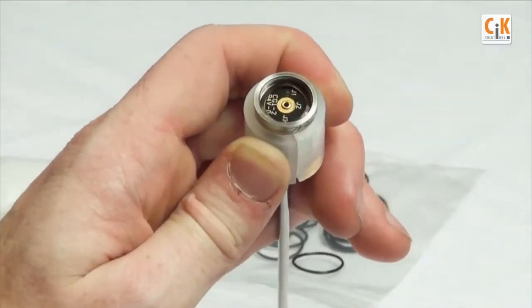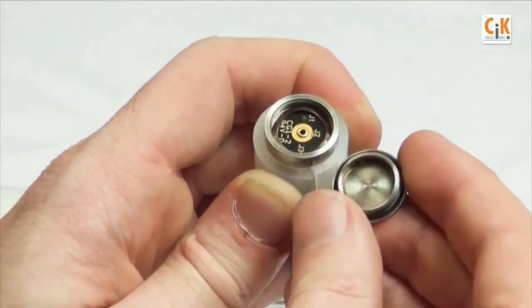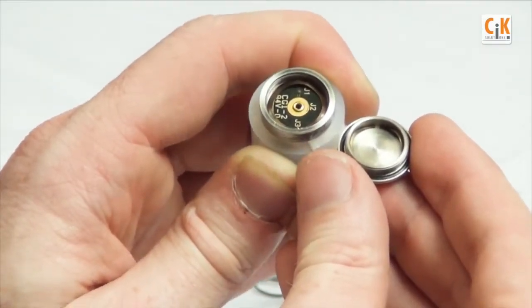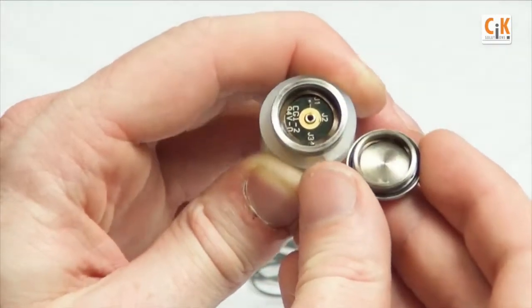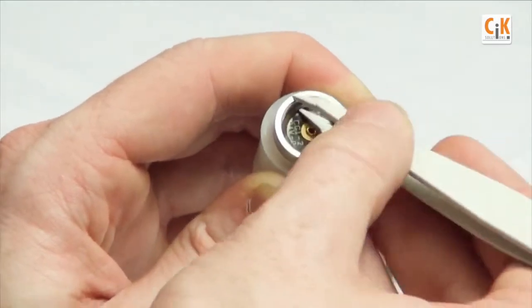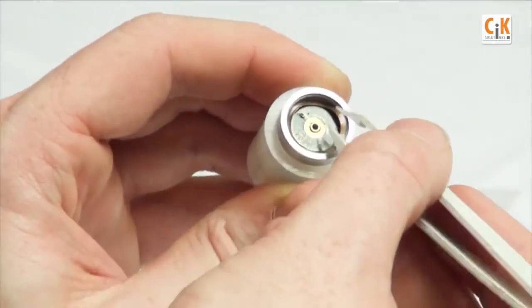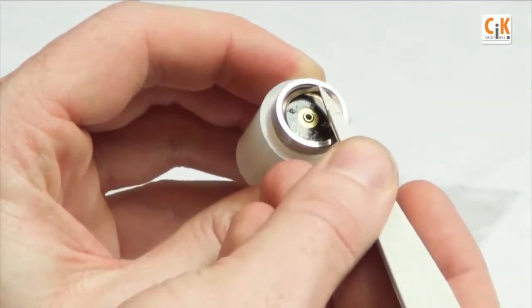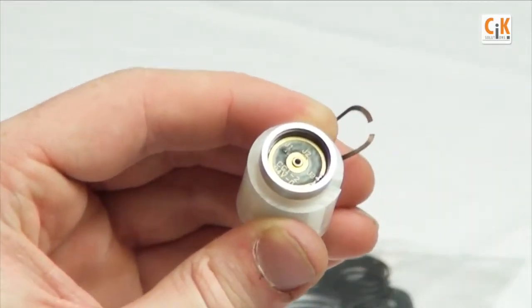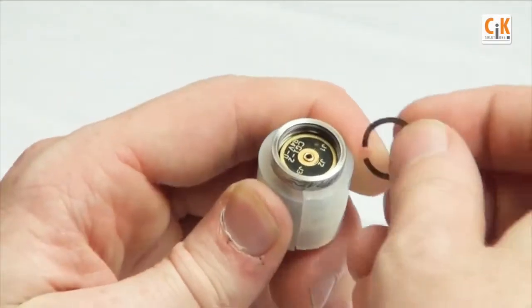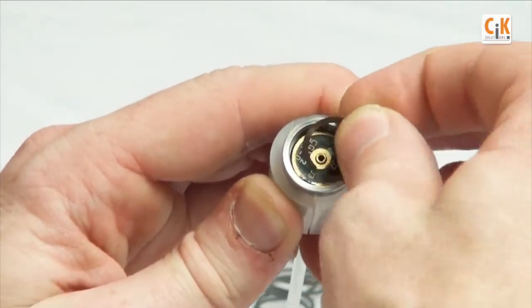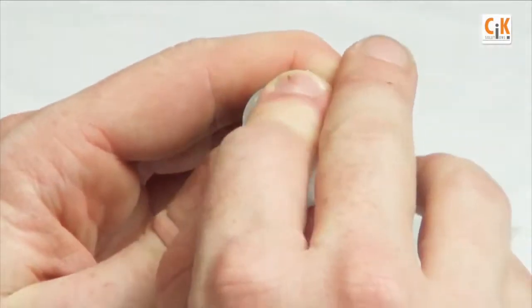Make sure that the wave springs are located correctly inside, and if one of the springs has fallen out, reinsert it. These springs are removable, and to reinsert, just take the spring open-ended facing down and push it back in with your finger.